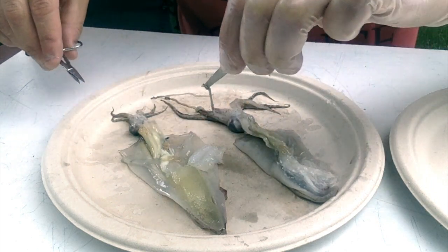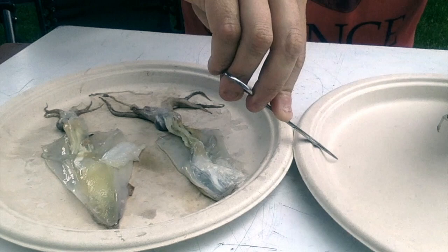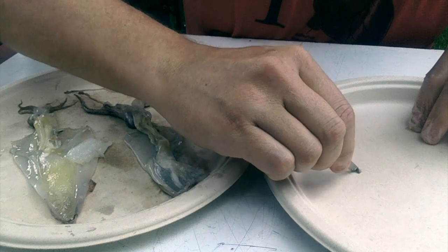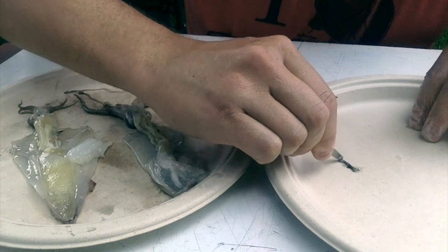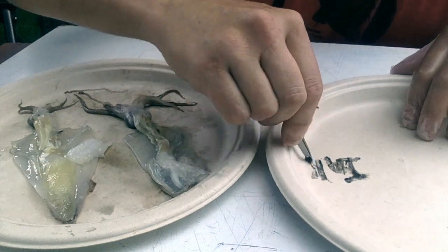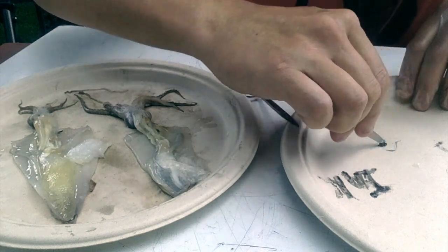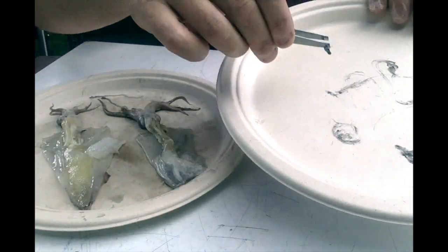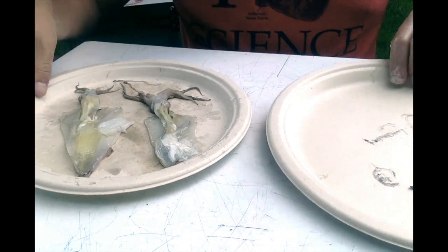And if I take this ink sac and puncture it, I might be able to. This is a really small one. Sometimes they're really big. So maybe I can use it to write something like ink and whatever else kind of design you might want to make. Yeah, I run out of ink over here. I wrote ink with the ink sac. All right, moving forward.